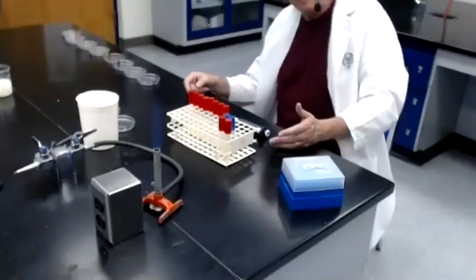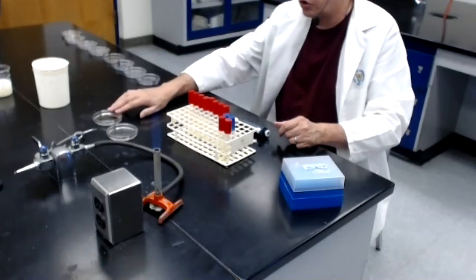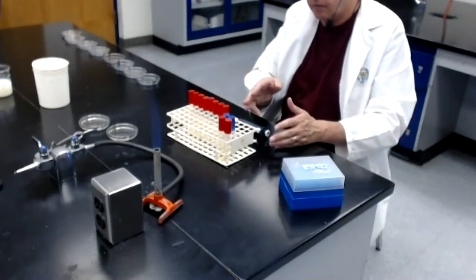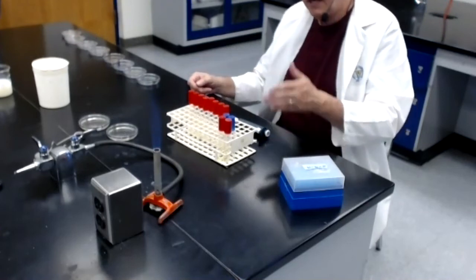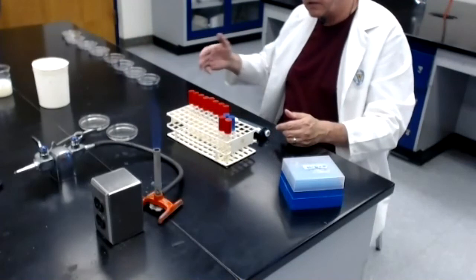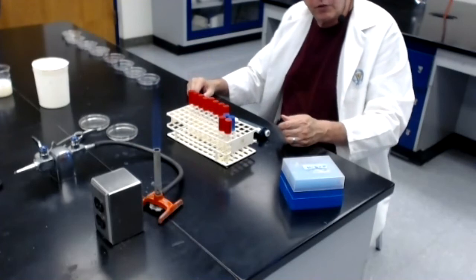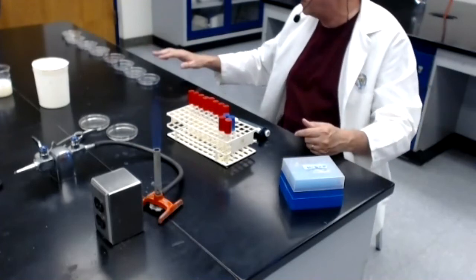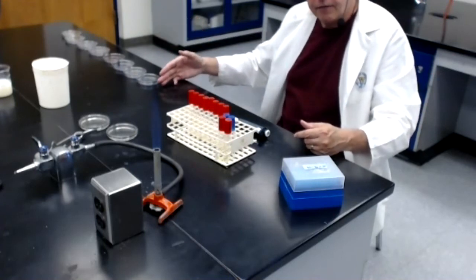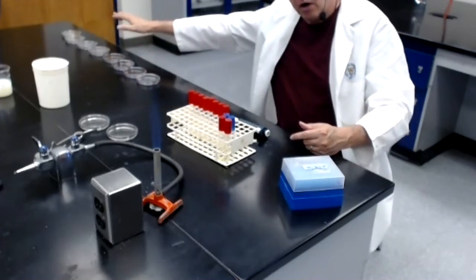And that's it. I've done that for 2 tubes, dilution tube number 1 and dilution tube number 2. Off camera, I will process the remaining 8 dilution tubes. 1 mil of each dilution tube will be placed into an individual tube of melted agar. The melted agar will be poured into the correctly numbered plate. So when I'm all done, I will have 10 plates labeled 1/10 dilution at the front end, at the left end, all the way to 1/10 billionth dilution at the far right end.